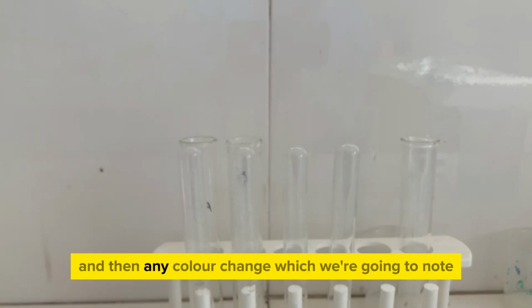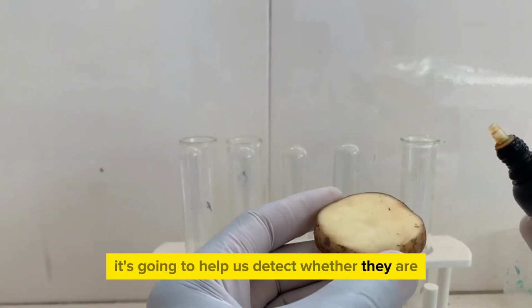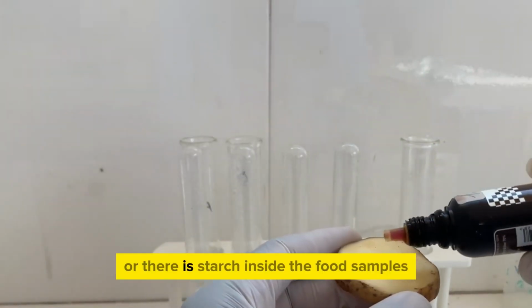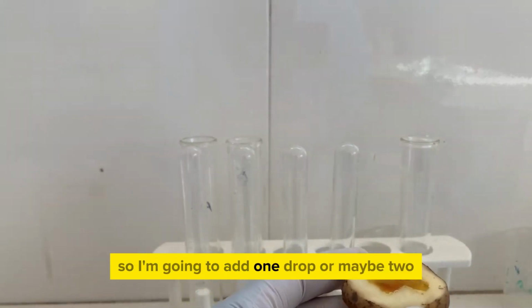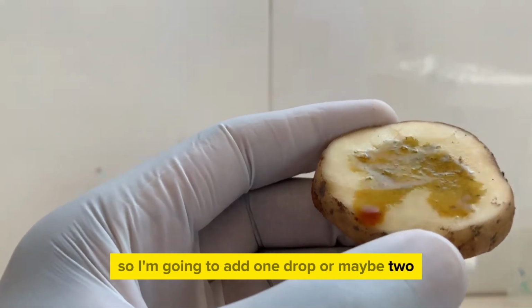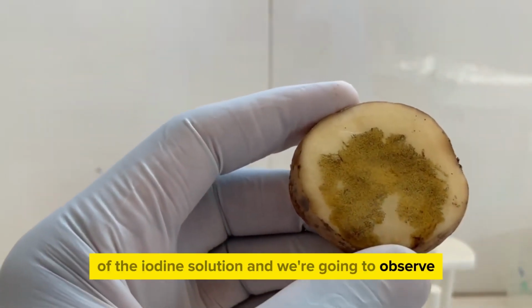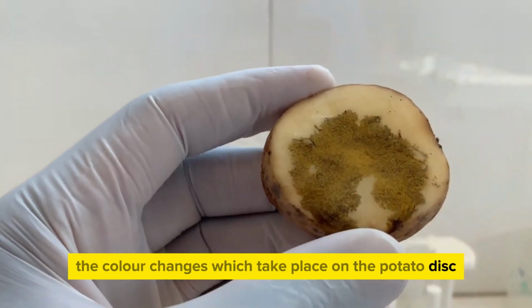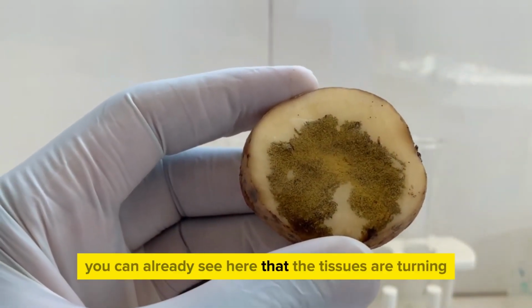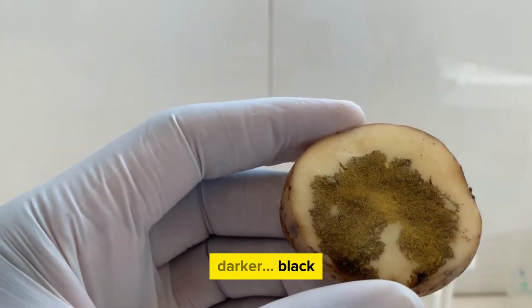And then any color change which we're going to note is going to help us detect whether there is starch inside the food samples. So I'm going to add here 1 drop or maybe 2 of the iodine solution, and we're going to observe the color changes which take place on the potato disc. You can already see here that the tissues are turning darker, black.